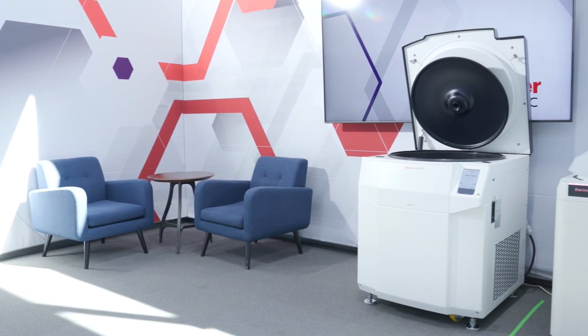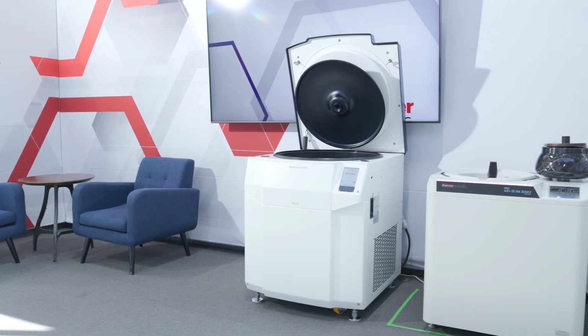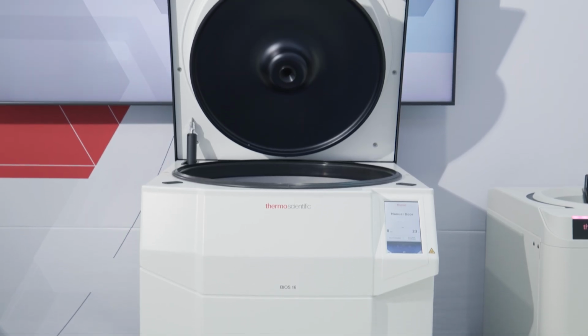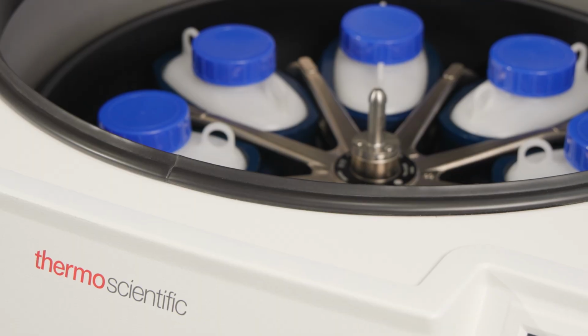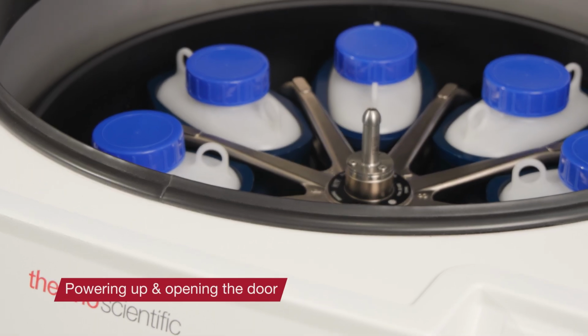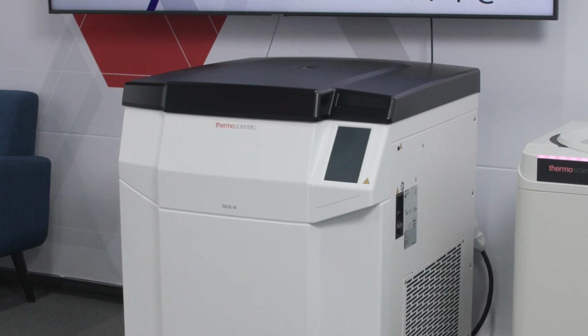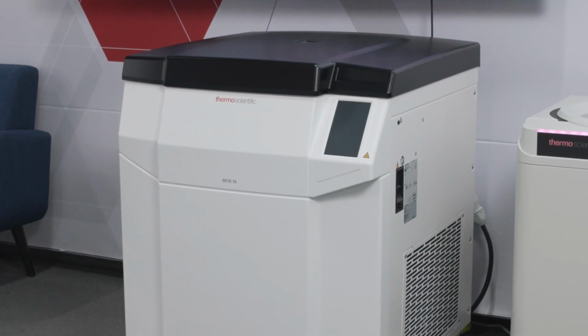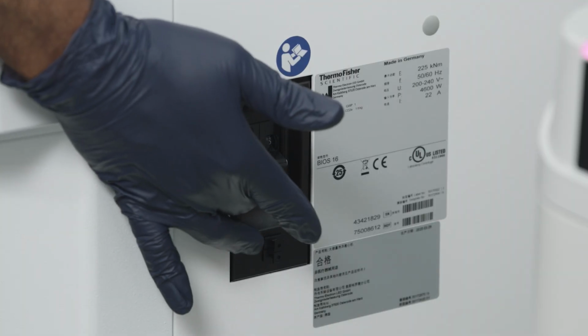In this video, we'll review how to operate Thermo Scientific BIOS A Bioprocessing Centrifuges with GreenCool technology. Before you begin using your centrifuge, make sure that it's been installed and balanced properly by the service team. The first step is to turn the power on. Locate the switch along the right side and switch it to the on position.